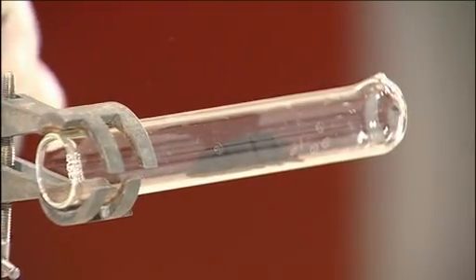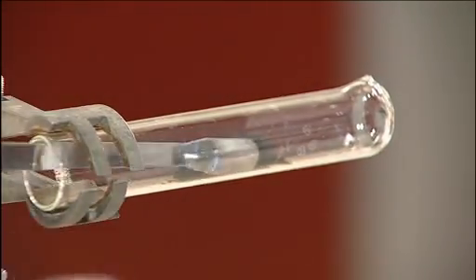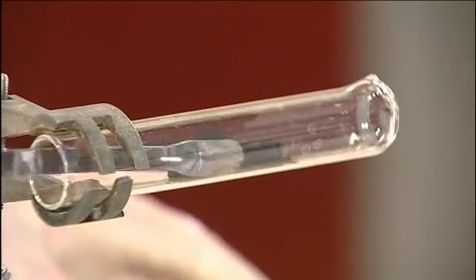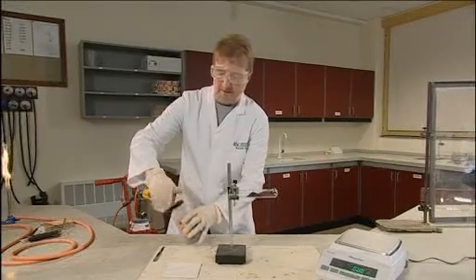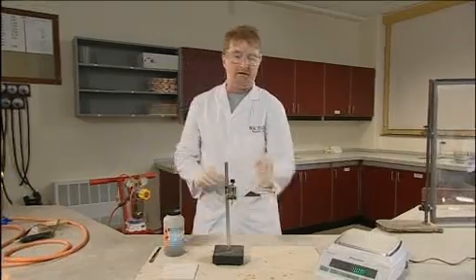Try to place this in the center of the tube. If it's too close to the hole end, there's a risk of the hydrogen flow blowing some of it out. If it's too close to this end, then there's a risk of heating the bung while we heat the copper oxide.